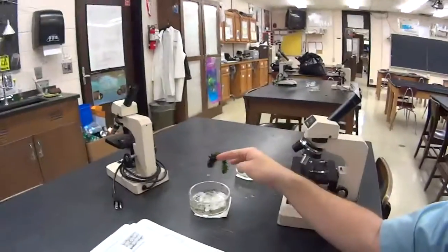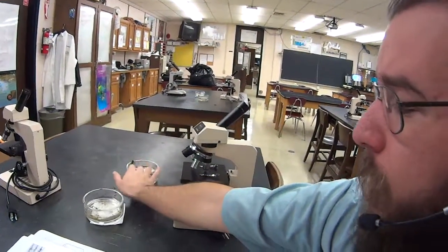After you get the leaf for part A, you're just going to put that over in the salt water, so it'll be sitting in the salt water solution. I wonder — is that going to be hypotonic or hypertonic? Either way, it'll be sitting in the salt water solution while you're doing your part A.